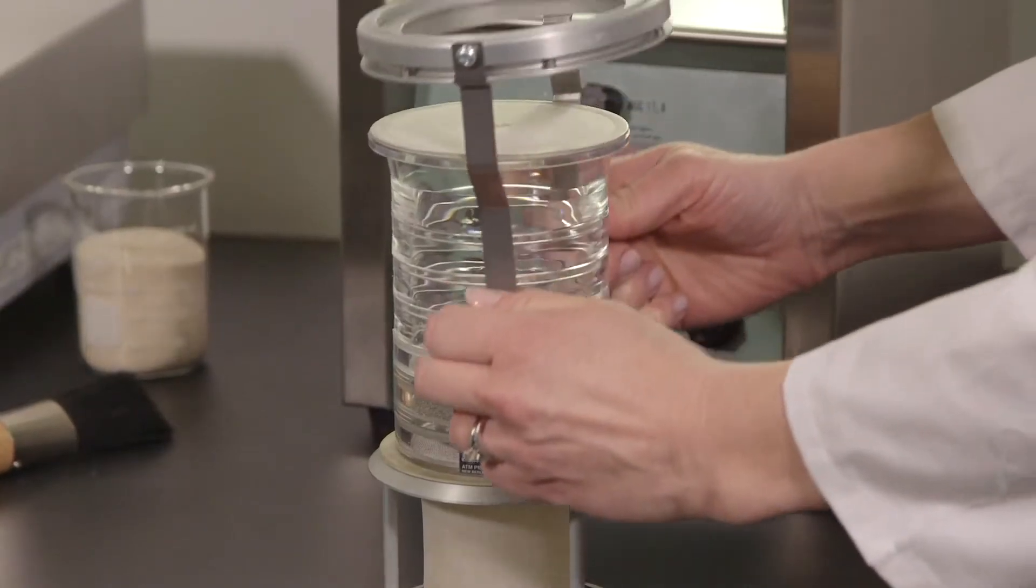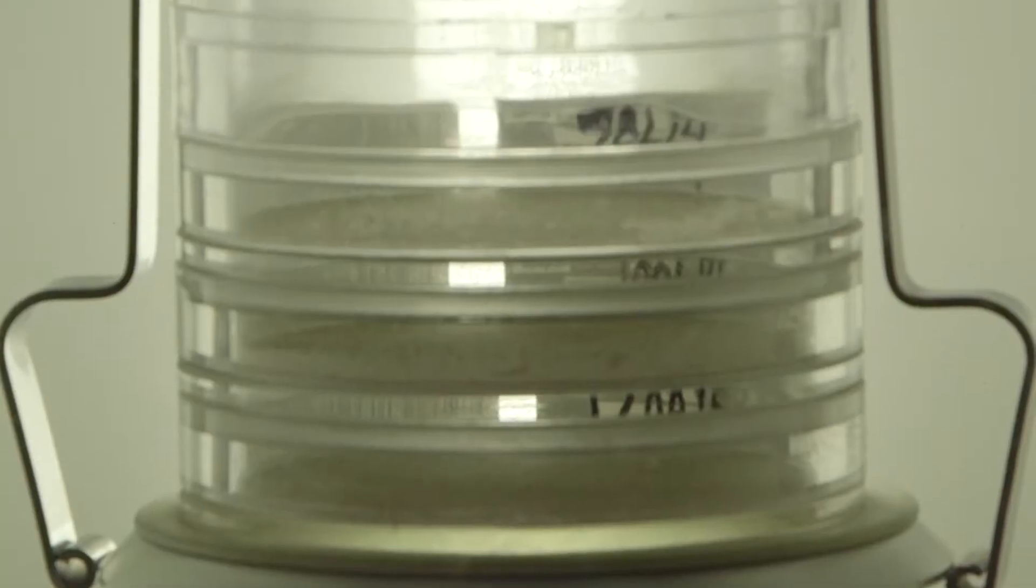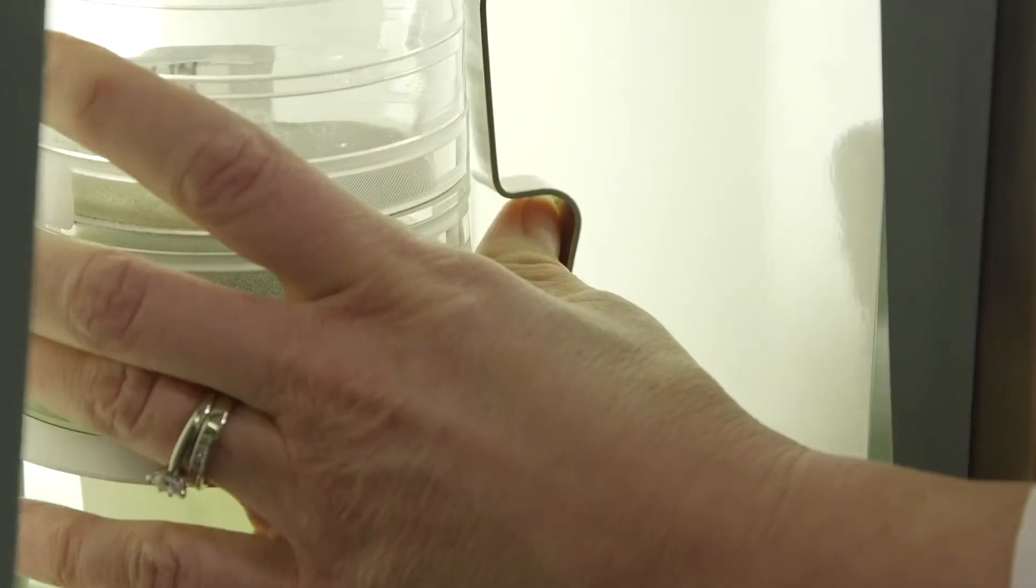Make sure the amplitude is set to zero and the timer is in clock mode or blank before starting. Sudden high impact from the driver could damage the sieves or compromise your sample.